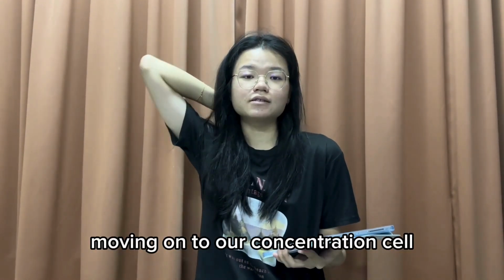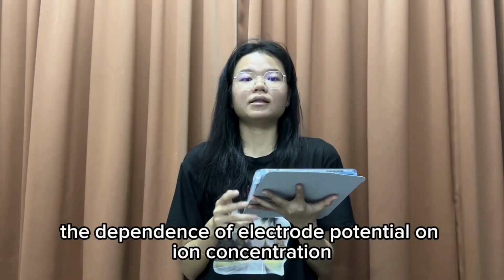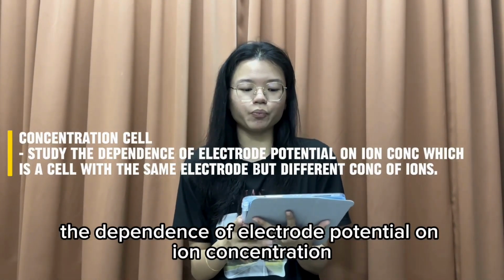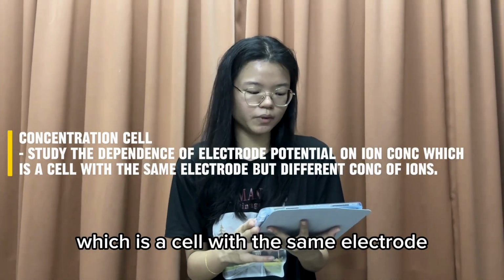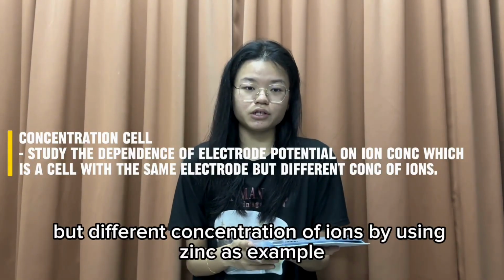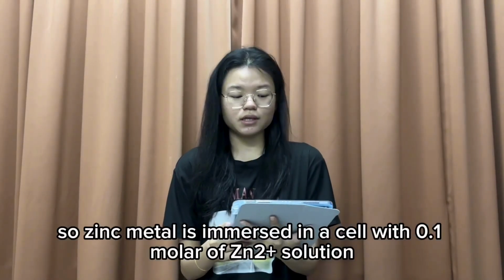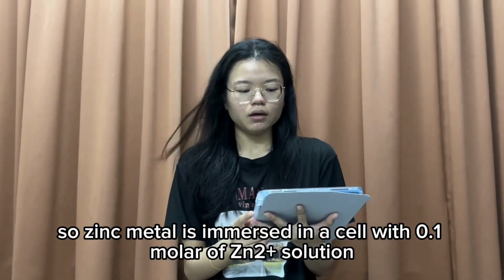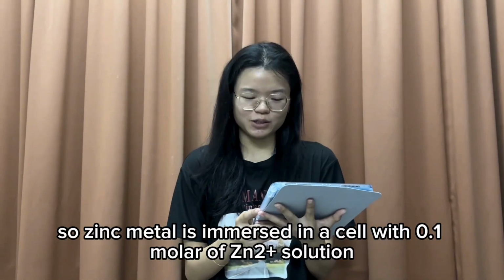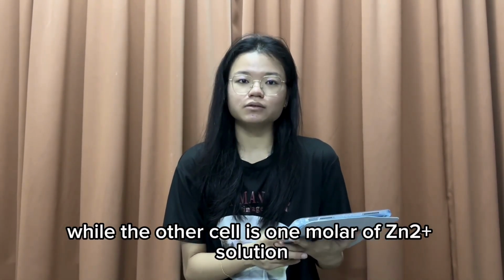Moving on to the concentration cell. A concentration cell studies the dependence of electrode potential on ion concentration; it is a cell with the same electrode but different concentrations of ions. Using zinc as an example, the zinc metal is immersed in a cell with 0.1 molar Zn2+ solution, while the other cell is 1 molar Zn2+ solution.